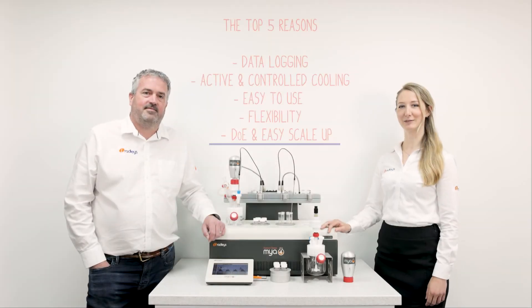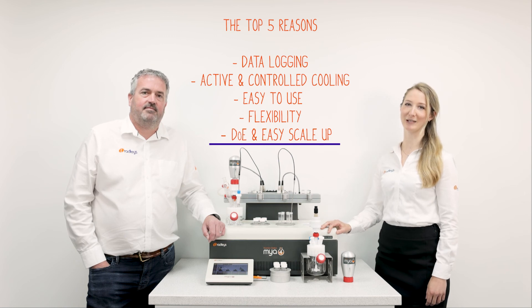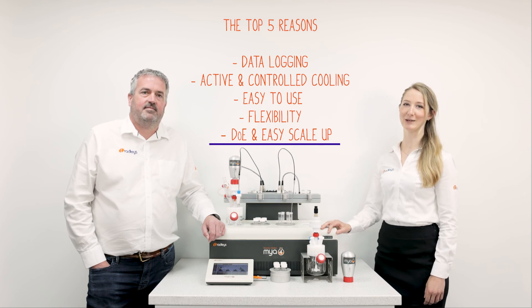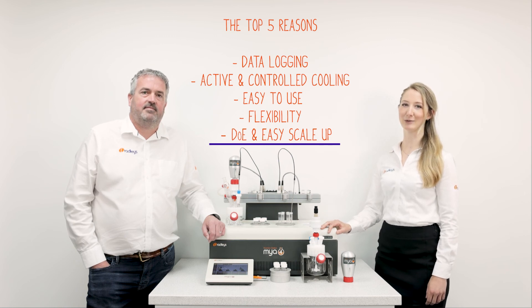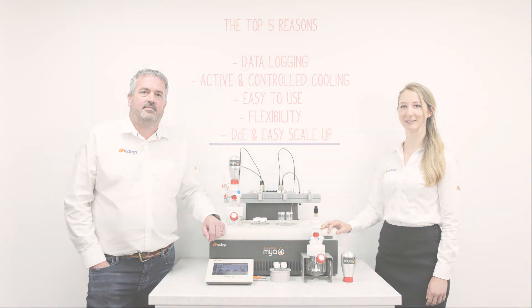So that's the top five reasons that people gave us, but there were many more that were mentioned. Why not book a live demo with one of the team and see for yourself?